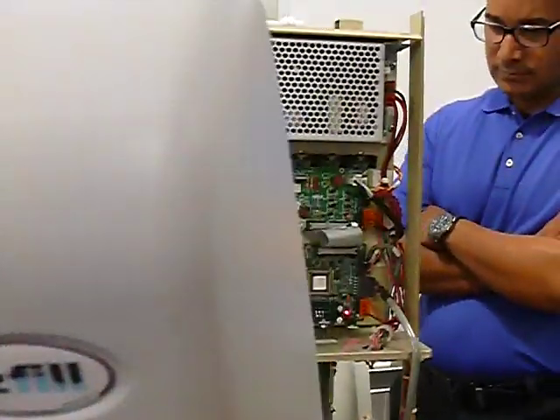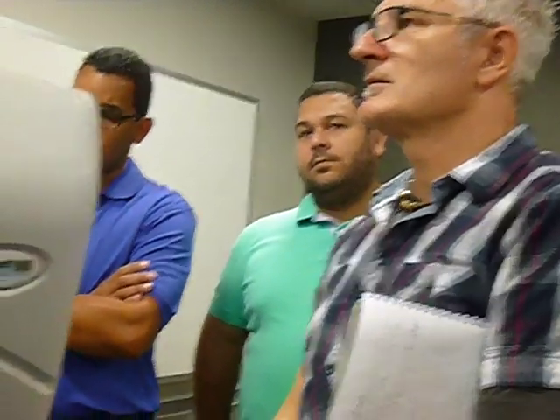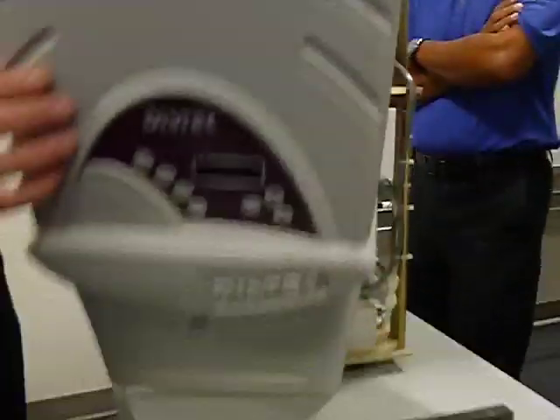So what is the second one? This is just a thermocouple. Thermocouple protection. Thermocouple, no PT 100. It can be short too, to heater, the thermocouple can be short. Yes, you have to check the same thing. It will give you an error message, a heating error message. All right, so we're gonna turn it on. We got it on, right? Yeah. And we're gonna watch this baby go.